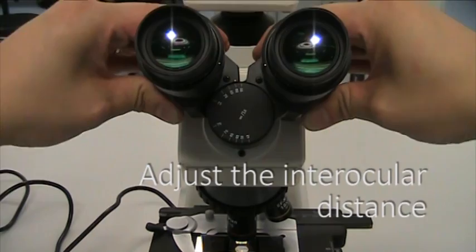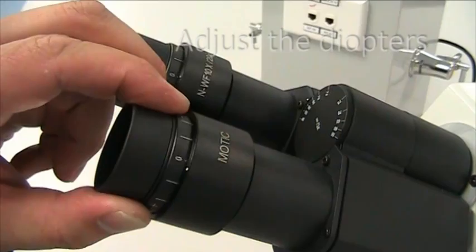Also, you may need to focus the diopters individually to accommodate for differences in vision between your two eyes.